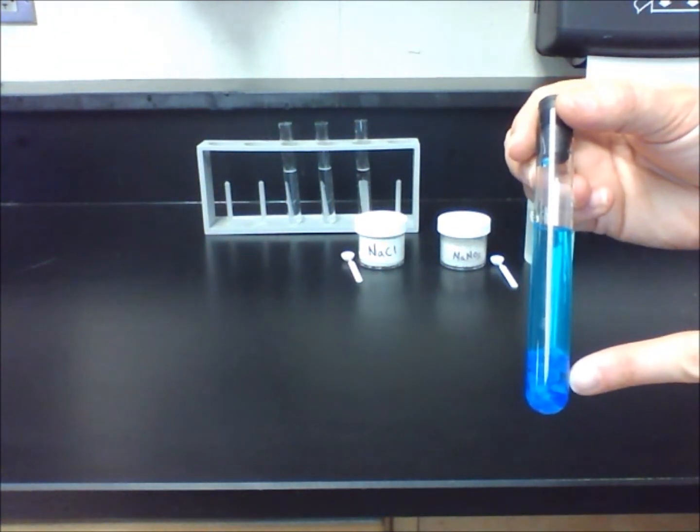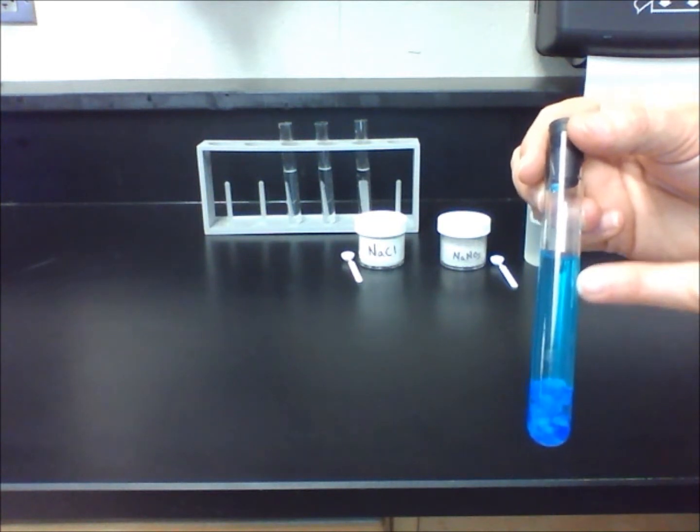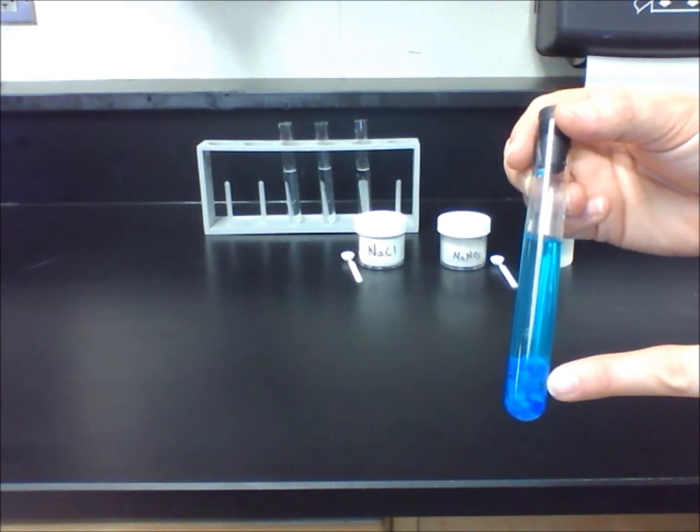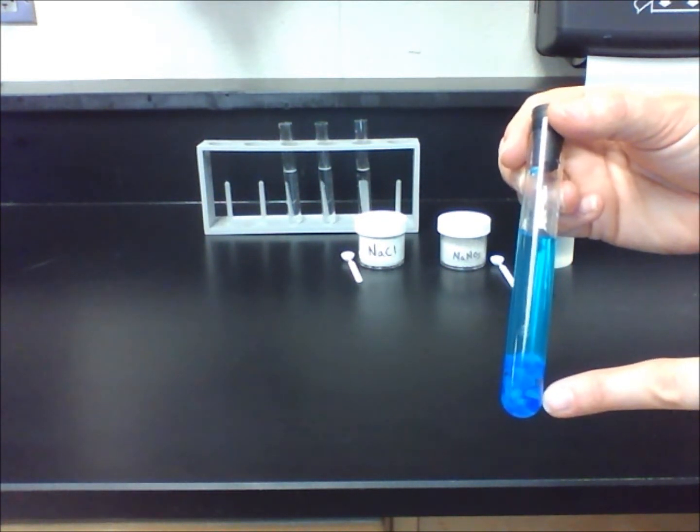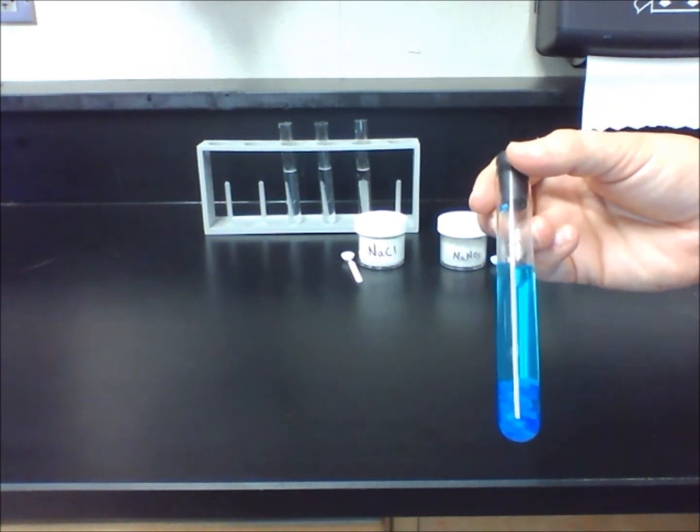Blue crystals are at the bottom of the test tube. The solute and solvent in the solution are blue. The crystals at the bottom of the liquid is undissolved solute.